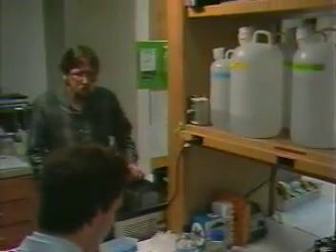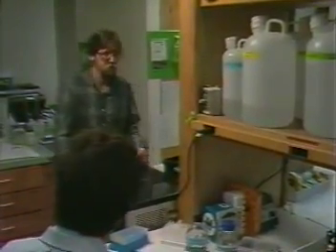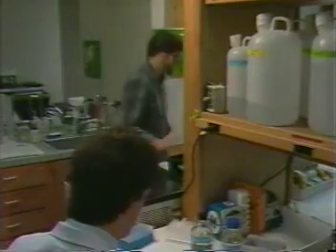Hi, Tom. How's your timing? Oh, pretty good, actually. I'm on the second to last wash. I'll be there in about 5 minutes. All right. We're running the dye laser? Yeah. All right. I'll go get set up.